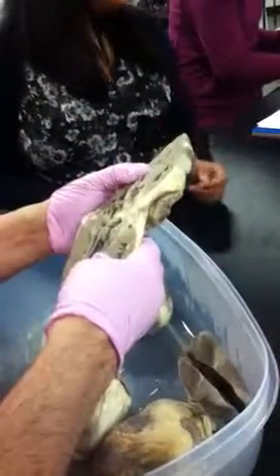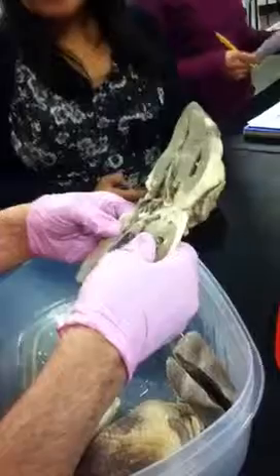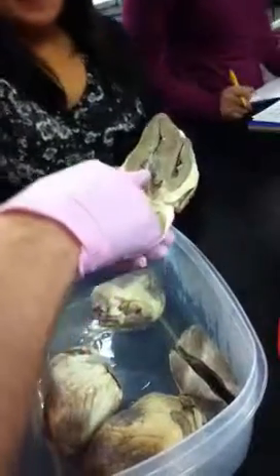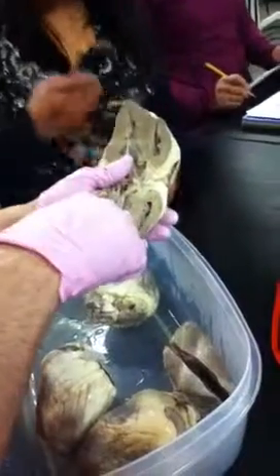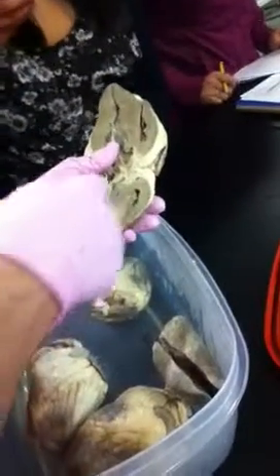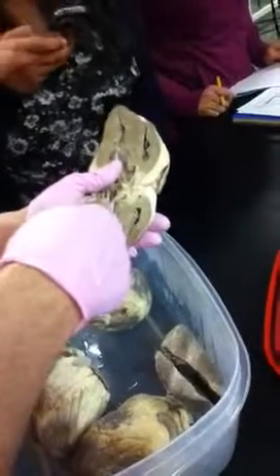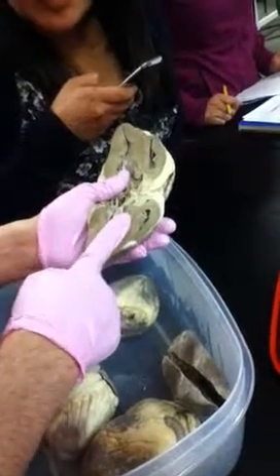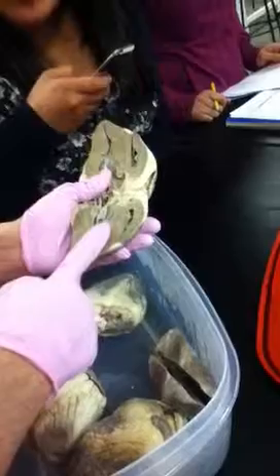So if it's gray, it's myocardium. Okay. So, if I pointed right here, I'd have to ask, is this a layer of the heart, or what is this actual structure? What's the structure? The structure would be the interventricular septum. The layer of the heart would be the myocardium.